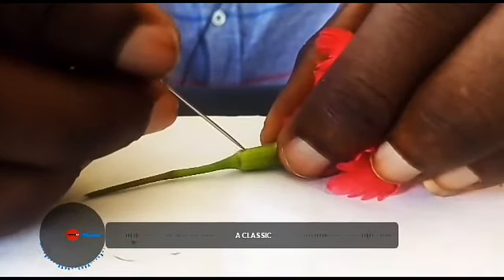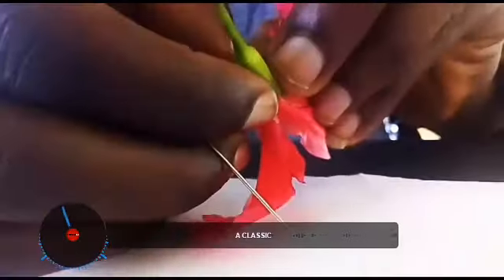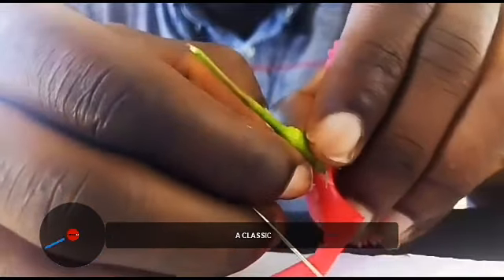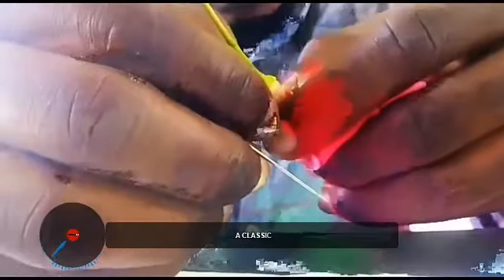Looking at the sepals, you pin down, we dissect the sepals too. We have a pin and a cut through the sepals. Now we have to remove all of them, collectively they are called the calyx. Don't forget you have removed the epicalyx. We are removing the sepals now, which are collectively called the calyx. You can see their color. After removing the calyx, you see the number of sepals we have.